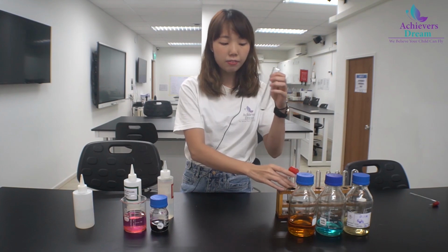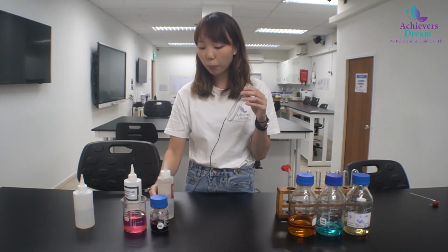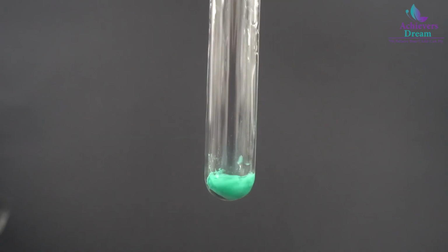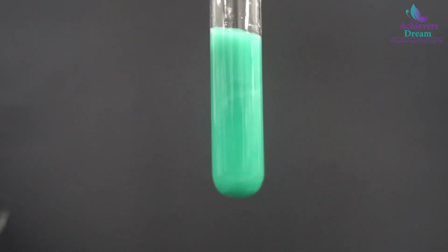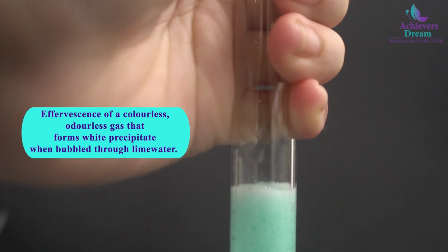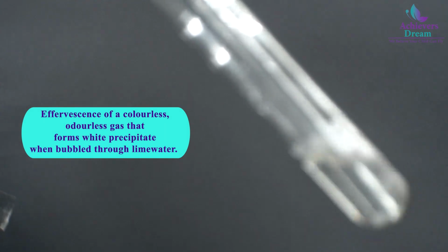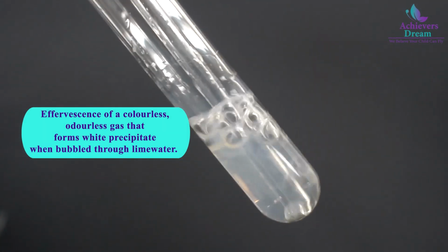Okay, and over here I have a sample of copper carbonate. I'll be adding in an acid. So the moment you add in an acid, you can see that there's effervescence, and I'll just quickly stopper the boiling tube. So you can see bubbles in your lime water.